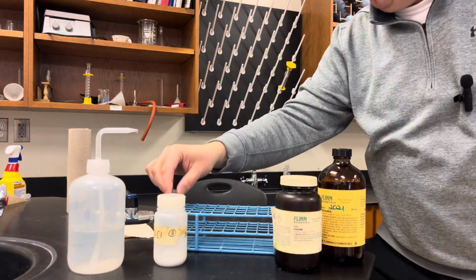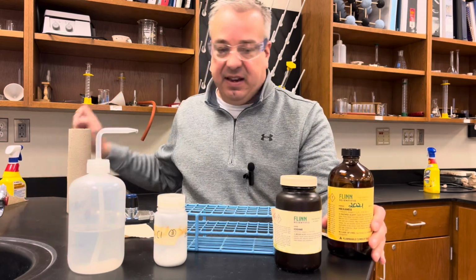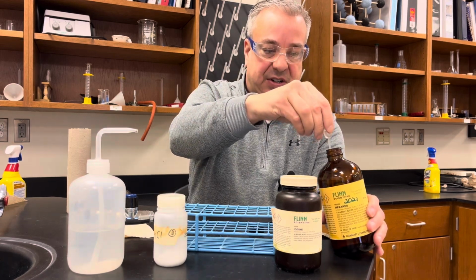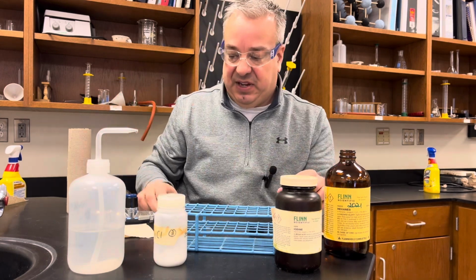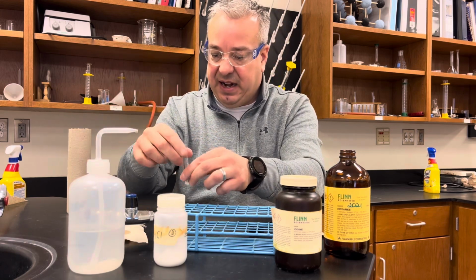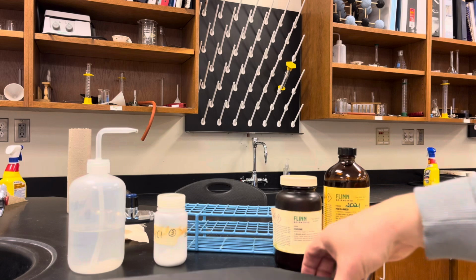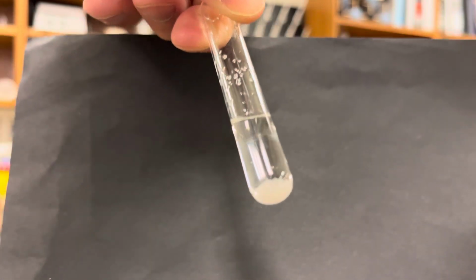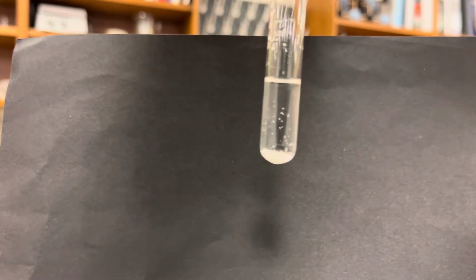Okay, and we're going to do the same thing with a nonpolar solvent, which is hexane. So I'm going to get some hexane out, and I'm going to put it into our other test tube that has the other half of the ammonium chloride. And I'm going to do the same thing. I'm going to use a paper towel, shake it up so it doesn't touch my hands. Put the cap back on, and we'll take a look to see if it dissolves. As you can see at the very bottom here, there's still some solute down there. It did not dissolve in the hexane.